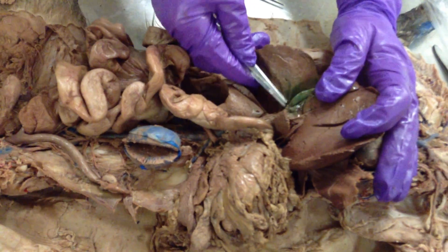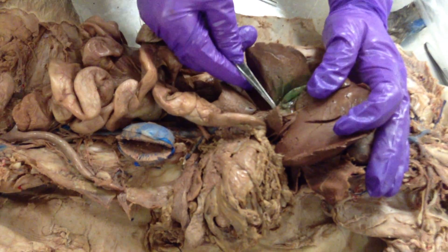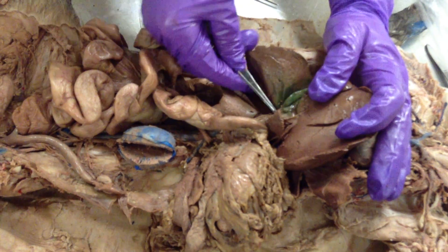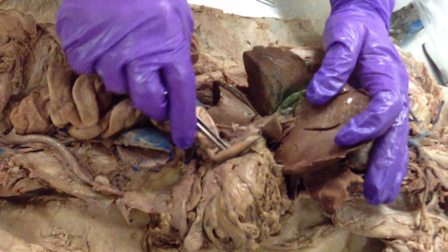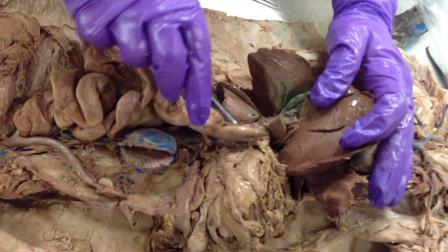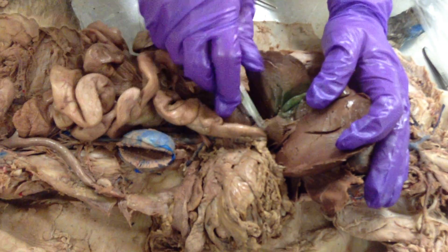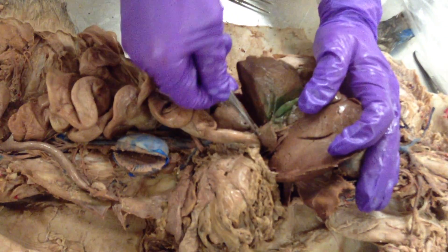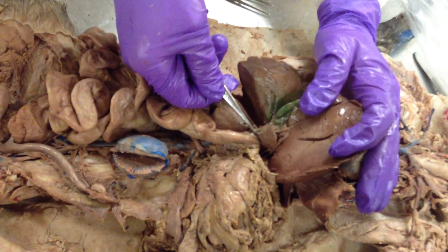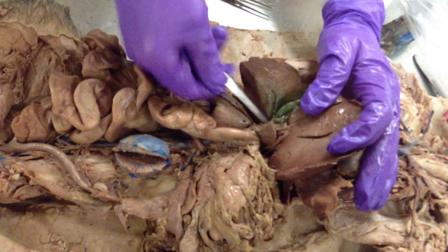You can look at your cat diagram for a better understanding, but this is the cystic duct. Then down lower, closer to where it empties into the duodenum, is the common bile duct. So right there would be common bile duct, and up here would be cystic.